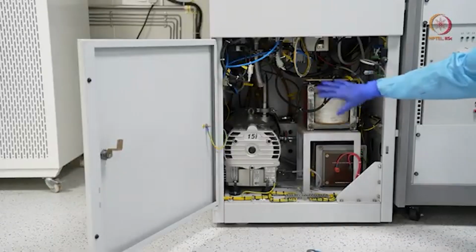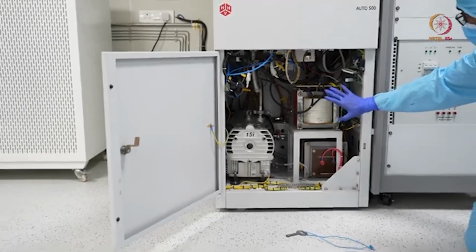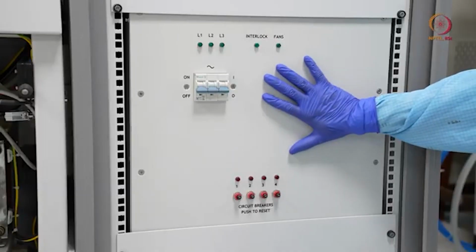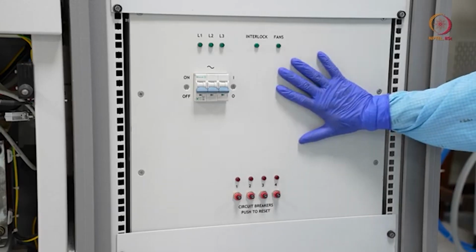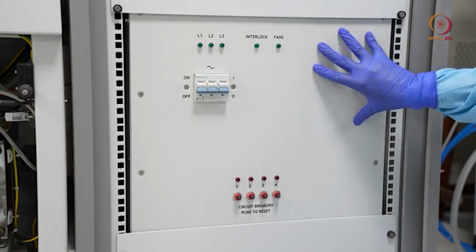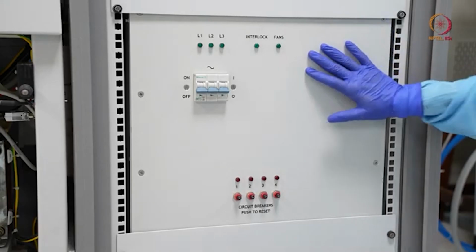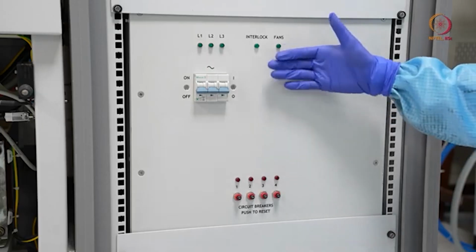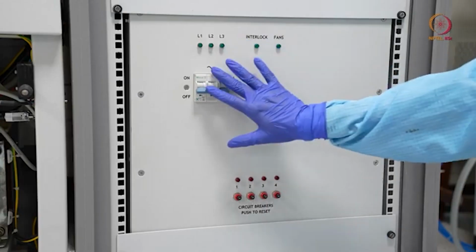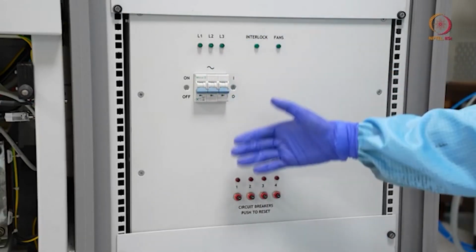So we have seen all the things we could show from this distance, and now we will come to this part. This is another transformer. This transformer is used to generate the electron beam. Only when we use this tool for electron beam, like generating electron beam for heating, that time we just switch it on, and we have one more supply that we will show later, during the process.